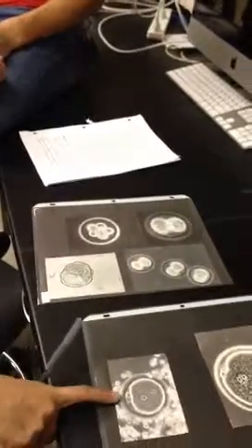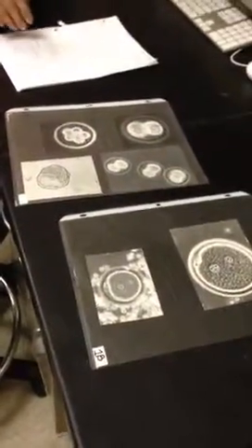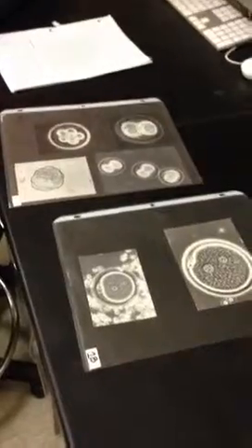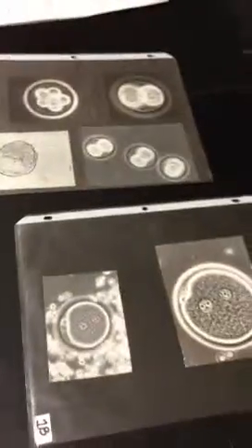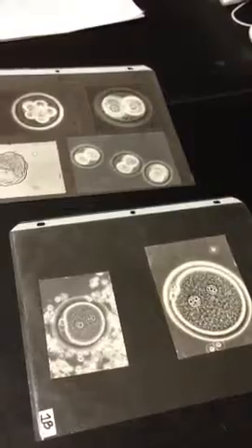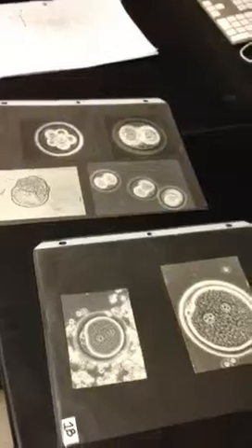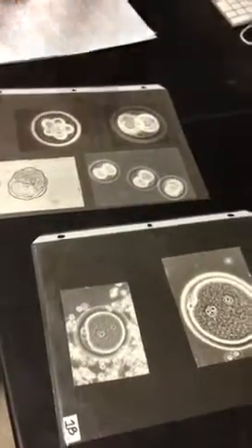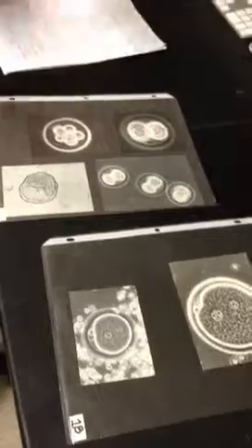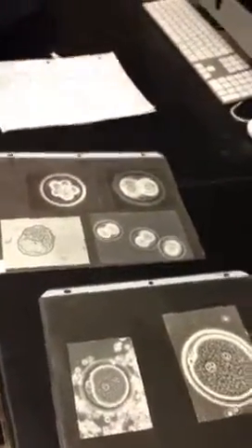What is this? These are the polar bodies. Oh, polar bodies? Yeah. So part of oogenesis is you have rounds of meiosis, unlike sperm, where one cell splits twice to make 4 cells, it's an unequal division in oogenesis. So you have one cell that becomes the oocyte and everybody else becomes a polar body that really isn't useful for fertilization. Shouldn't there be 3 though? No, because the first polar body doesn't divide again. And then the second polar body doesn't divide again either.